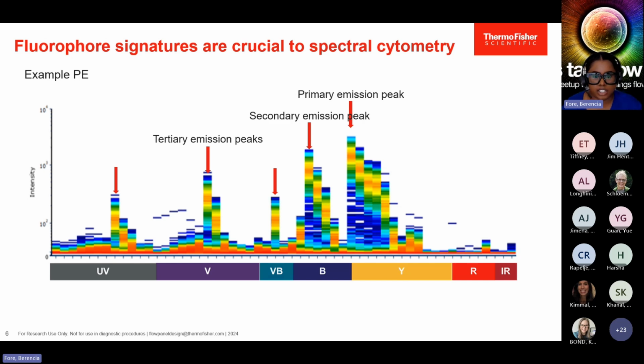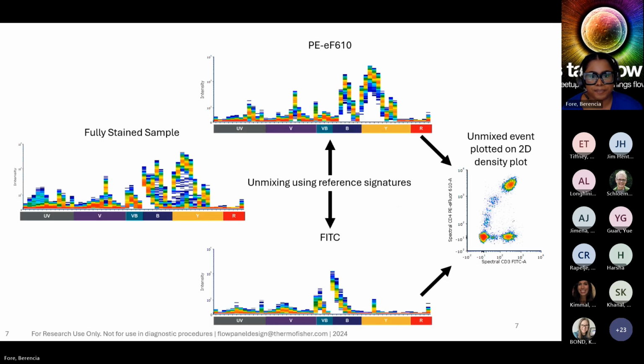You can also use the signature to troubleshoot contamination or tandem dye breakdown. Let's say you're trying to look at PE-Cy7, but you notice that the PE signature is dominating. This might give an indication that there has been some significant tandem breakdown. This is just an illustration that paying attention to the signatures is crucial when you're running them on your flow cytometer.